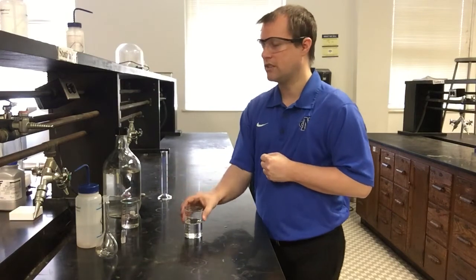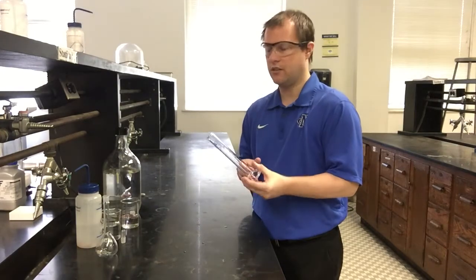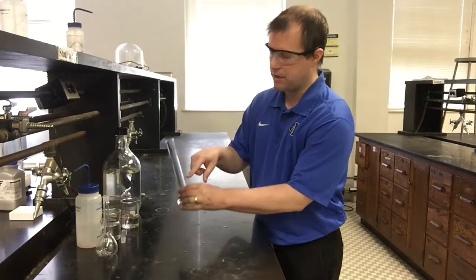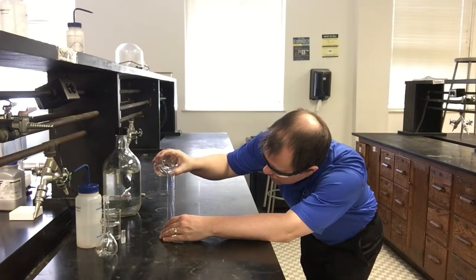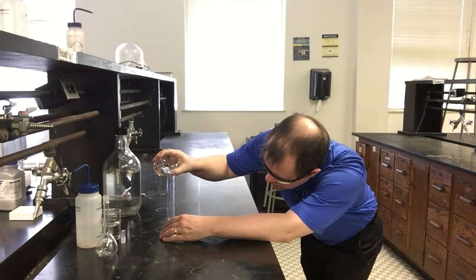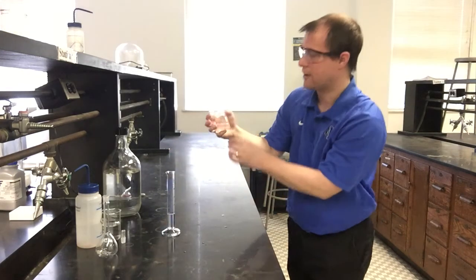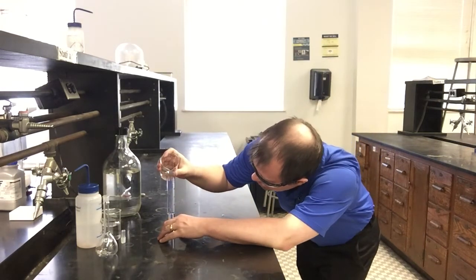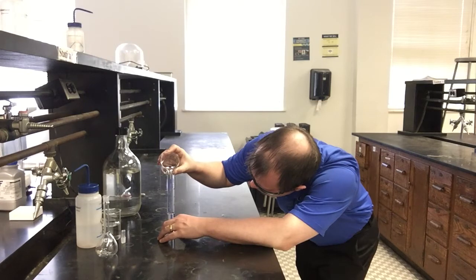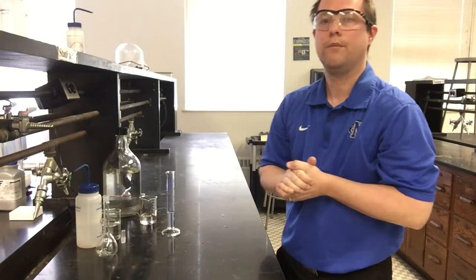And so this is my starting sodium carbonate solution, and I know we just said we need 20 milliliters of it. So I have a graduated cylinder here. This is a 50 milliliter graduated cylinder, and I'm going to measure out 20 milliliters of my sodium carbonate stock solution. It's important to use a graduated cylinder for something like this because beakers are not very accurate in terms of their measurements. This beaker does have a line on it for 20 milliliters, but that line is not accurate at all in terms of the number of significant digits that we would want. So that's why I'm using a graduated cylinder for this. And that should be pretty close to spot on 20 milliliters now in my graduated cylinder.